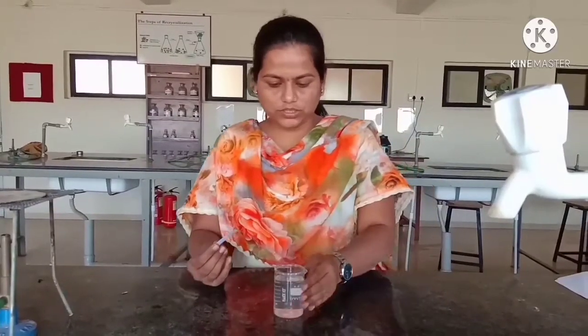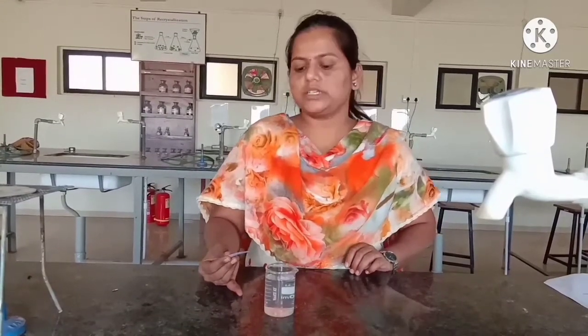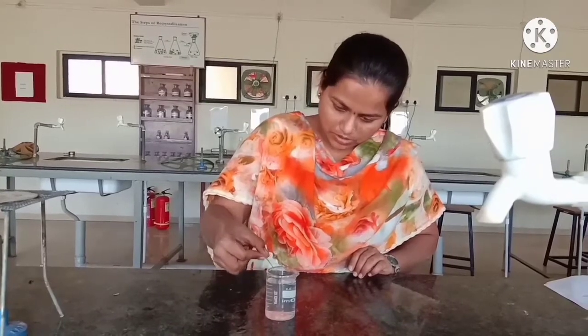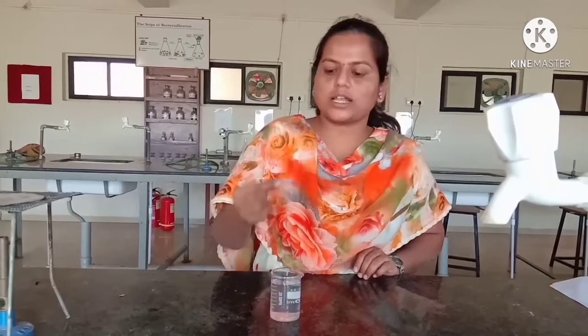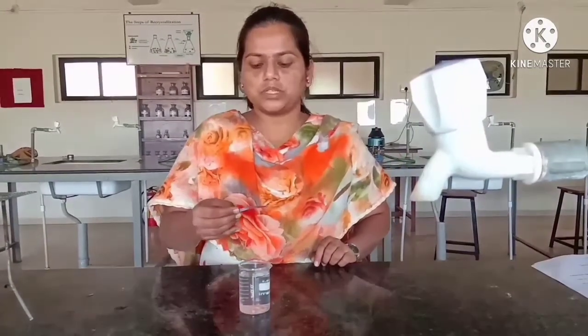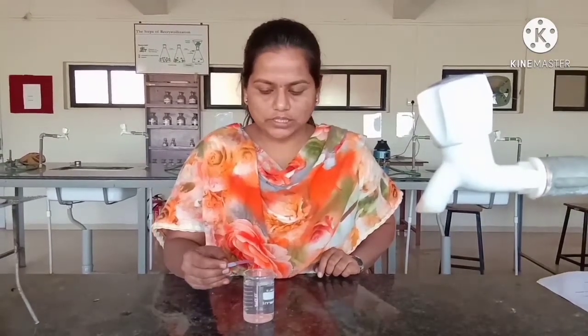After cooling the solution, dip a litmus paper into the solution so that we can find that the boric acid solution is faintly acidic to litmus. Here you can see that a blue litmus paper turns red, and as the blue litmus paper turns red, we can confirm that this solution is acidic in nature, and hence the test complies.